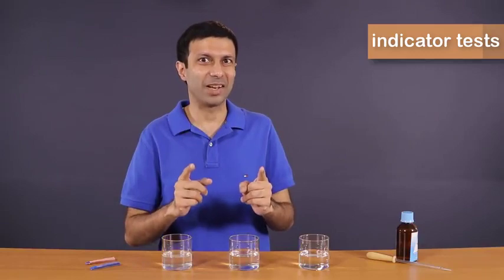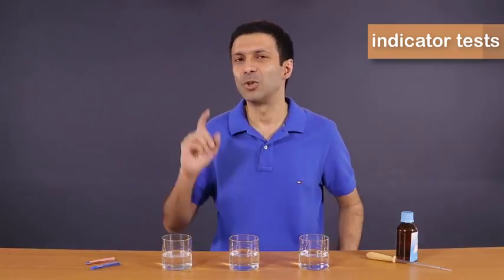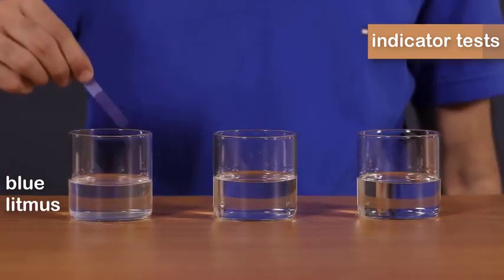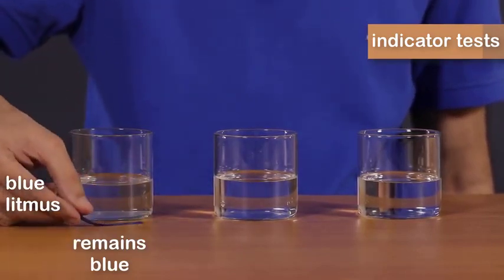So are you ready to try it out and be a detective and guess which one is an acid, base, or salt? So let's start with the blue litmus paper. I'm going to dip it in this first solution. As you can see, there's no color change. The blue litmus remains blue.